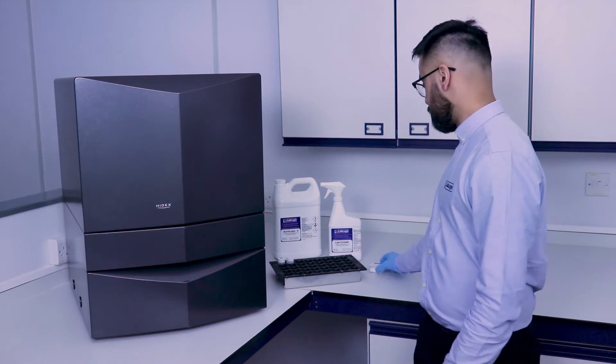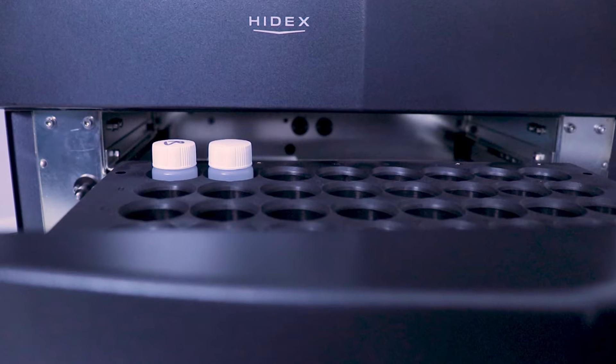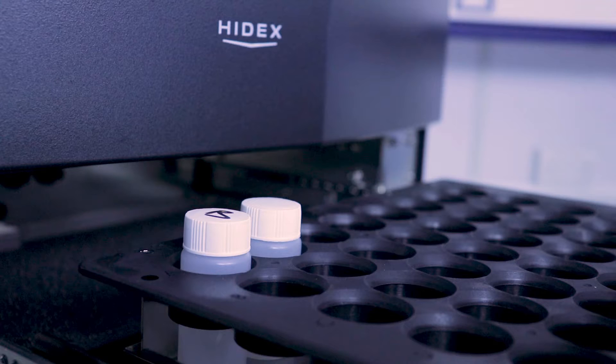We recommend lab wipes since it is dissolvable in scintillation cocktail. We can also use filter papers or swabs. Only use materials designated for wipe testing, otherwise you risk unwanted luminescence.